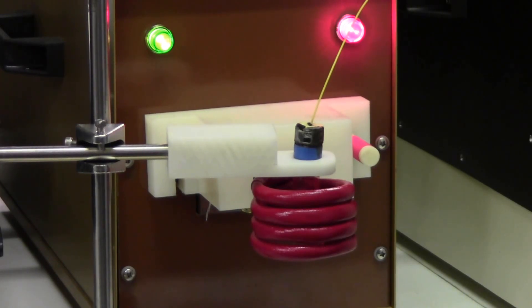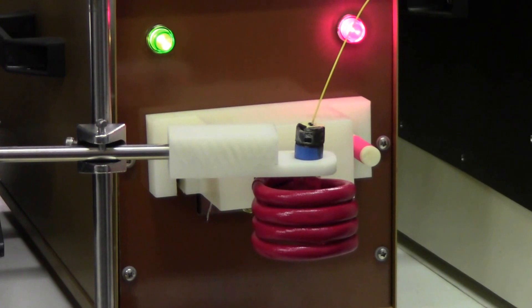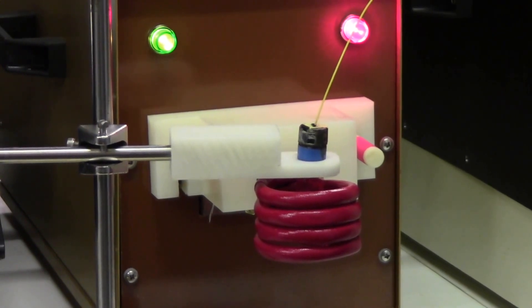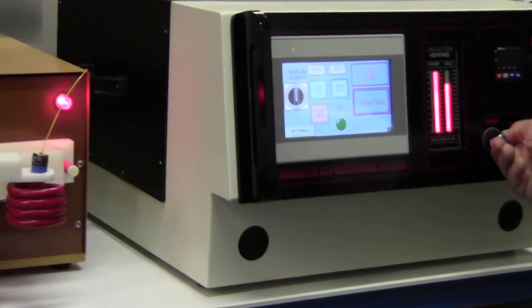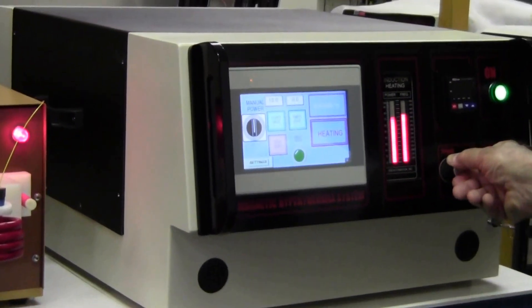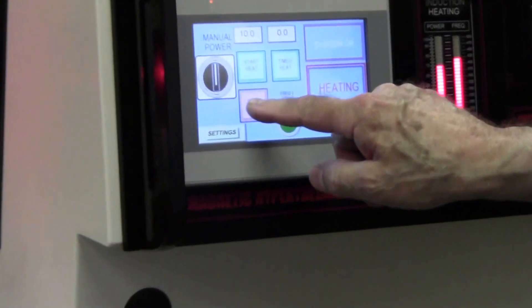We have an indication this system temperature is okay and heating. And as you can see from the display, I can modulate it up and down. And we'll turn it off.